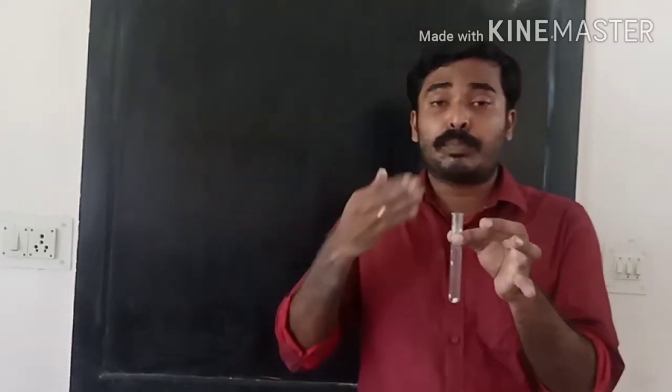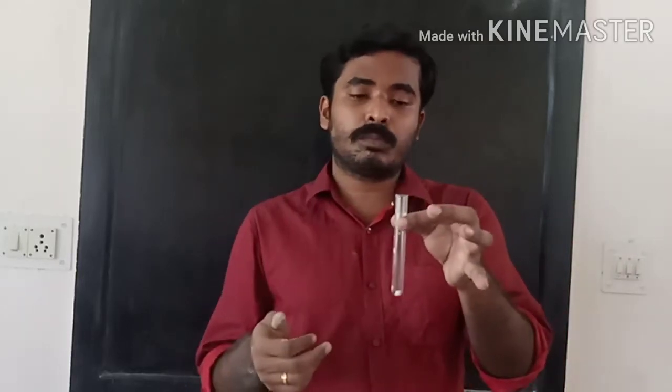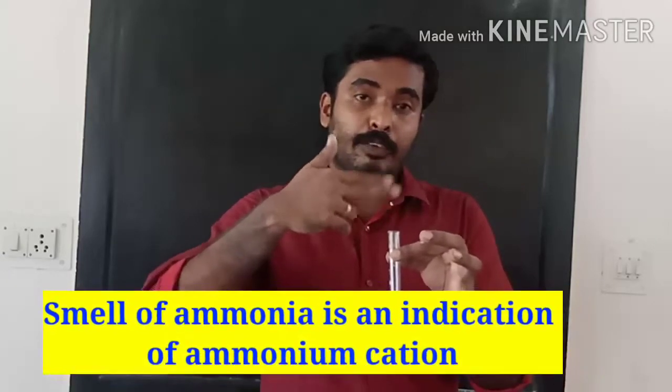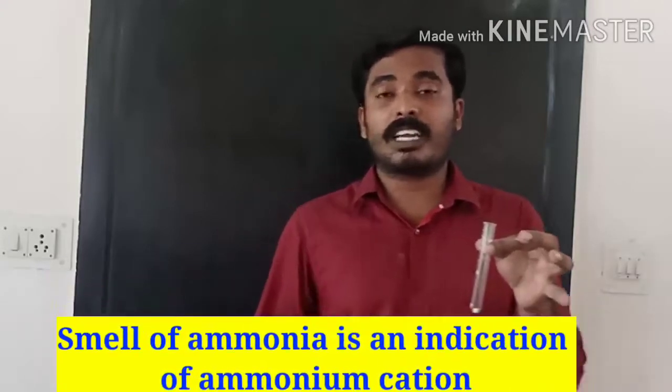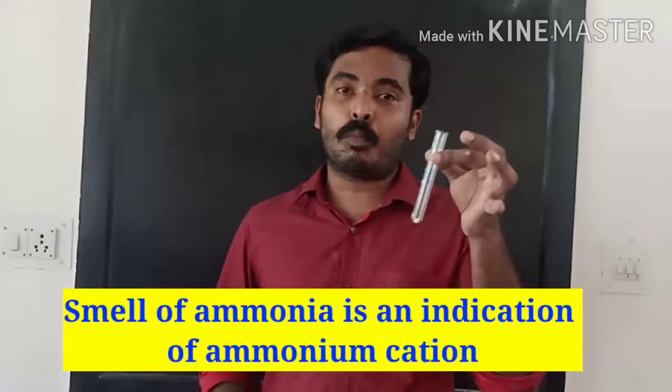This has a smell of ammonia. How will I smell this test tube? You shouldn't smell directly. Please keep it at a distance and wave like this and then take the smell. If it is in a watch glass, that will be better. So this has a smell of ammonia.